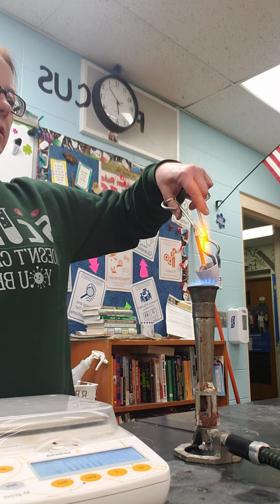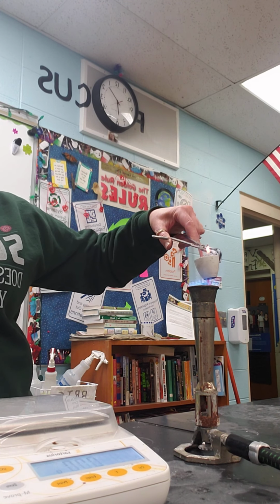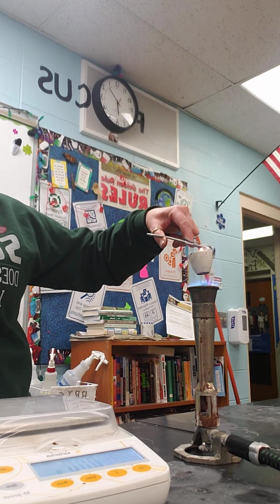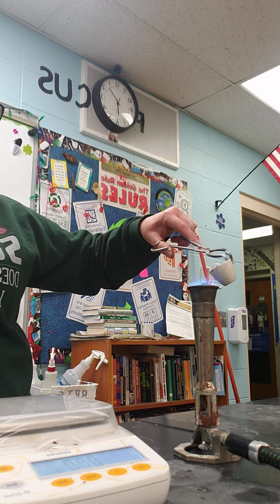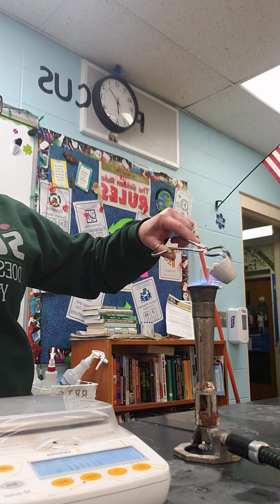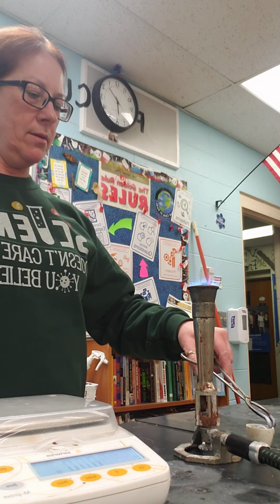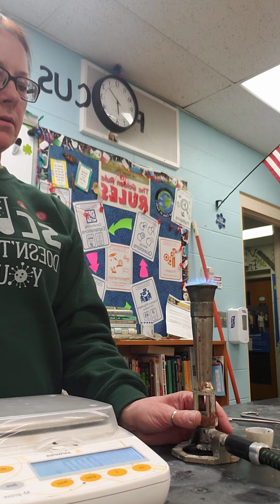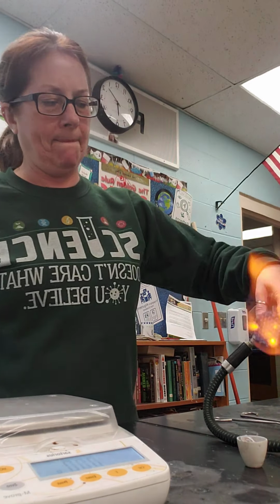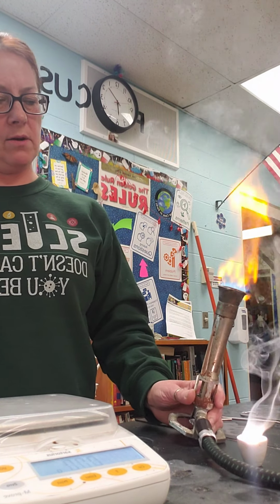and now I am going to heat it. All right, so you can see, whoopsie. Well, I'll collect that mass. Don't want to lose any of that mass. Okay, come on here. All right, so this is a good thing I'm doing this and you're not. There we go. Got her going.